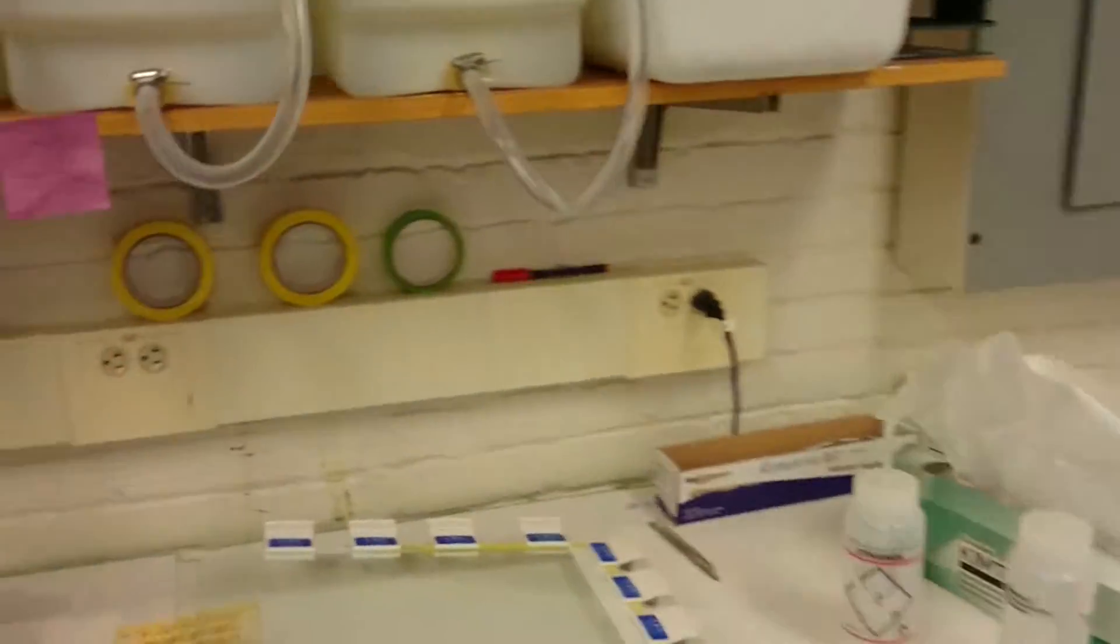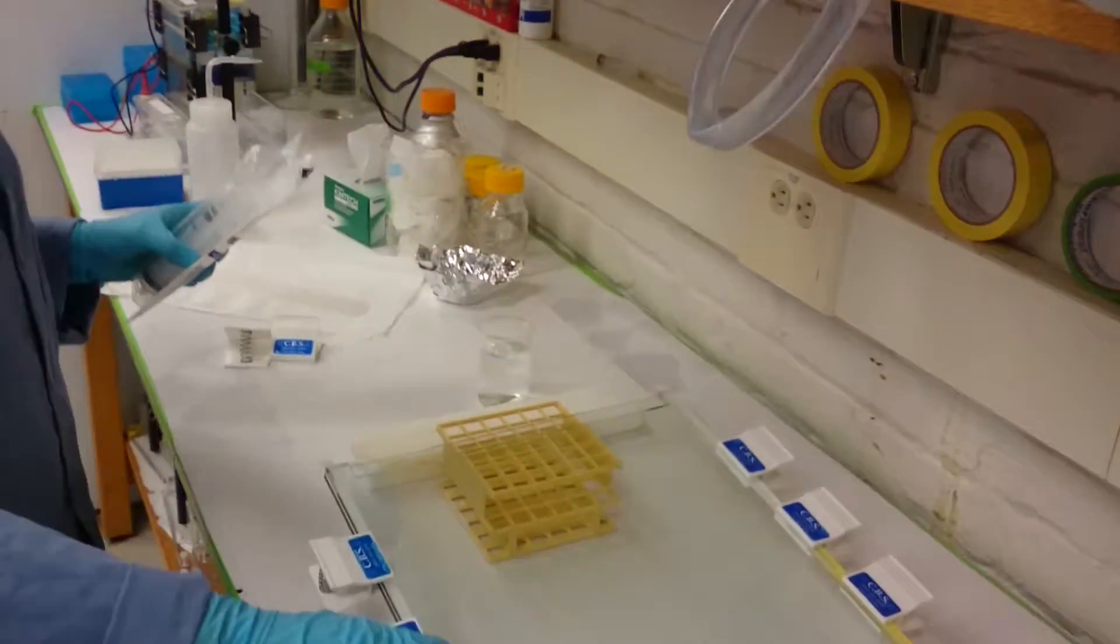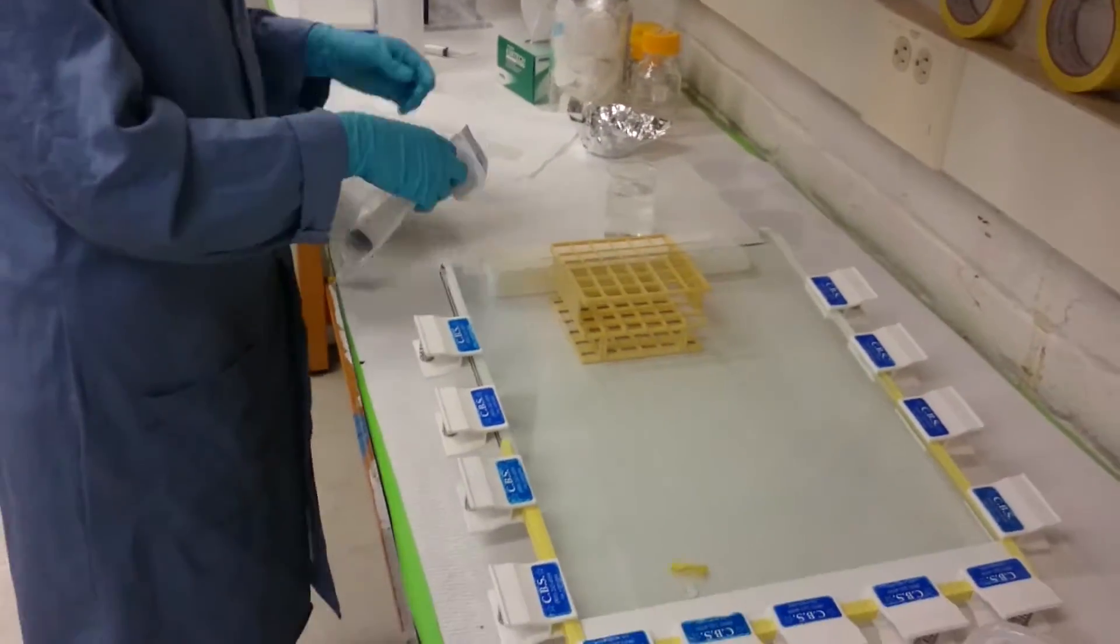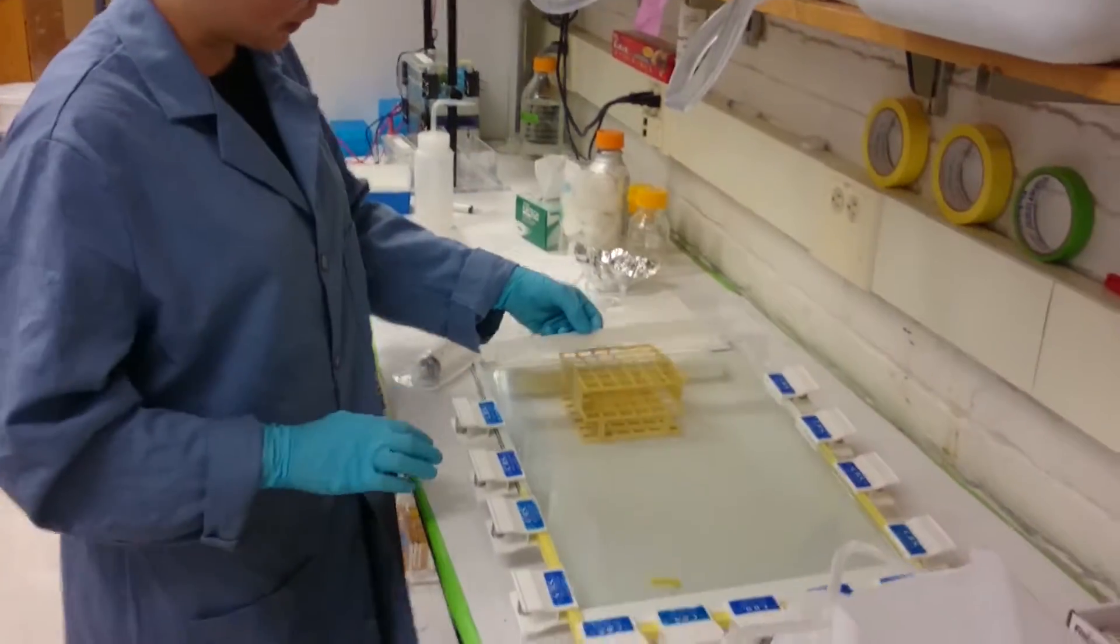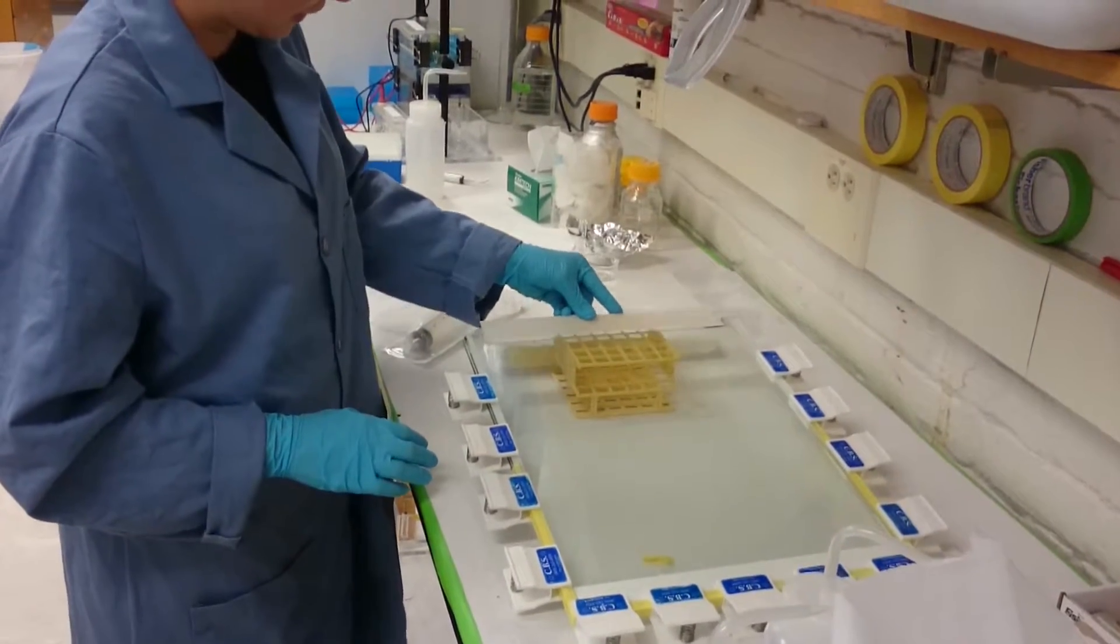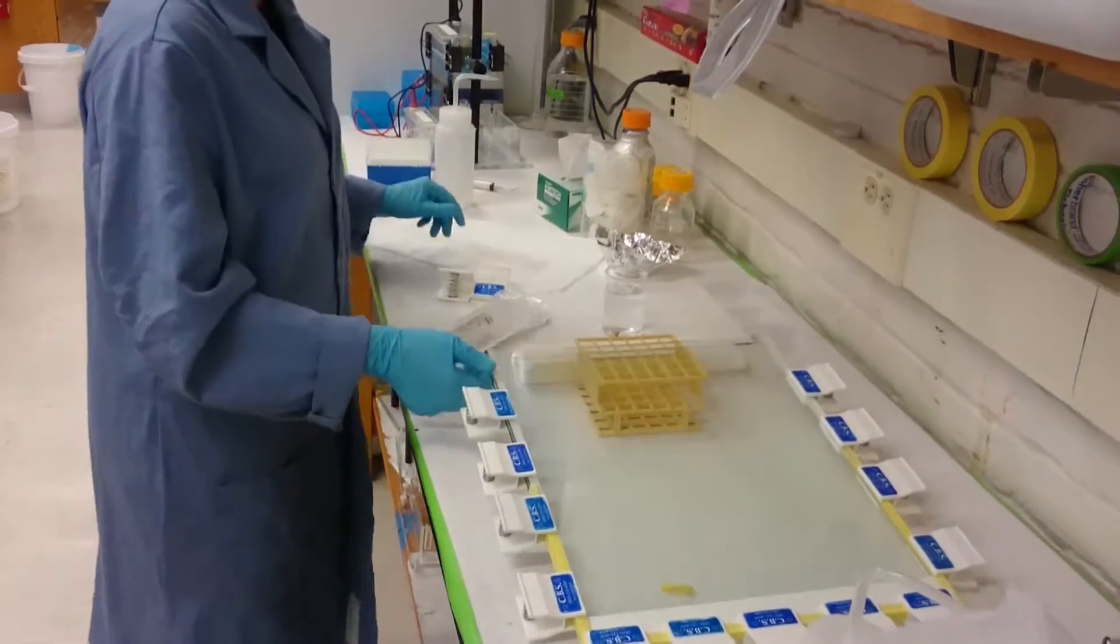Over here, I am ready with my gel taped and clamped, and a 60 milliliter syringe to load it with. I've also checked that the top clamps are far enough down that the comb will still fit in. Once the comb is in, we'll clamp the very top.